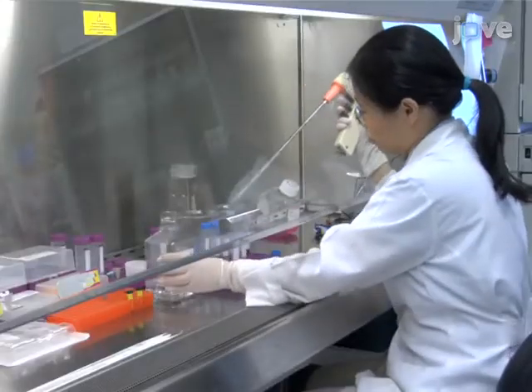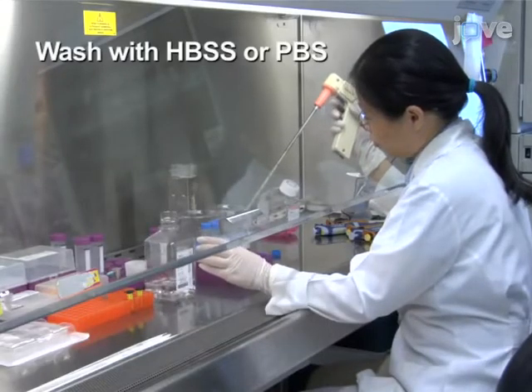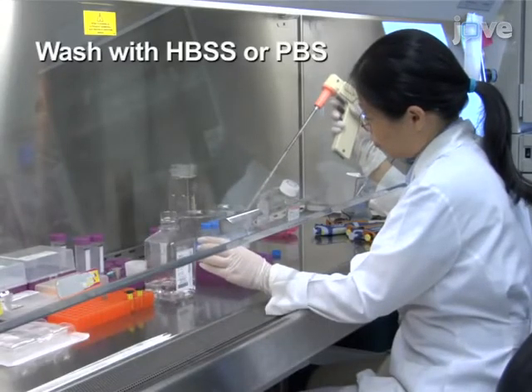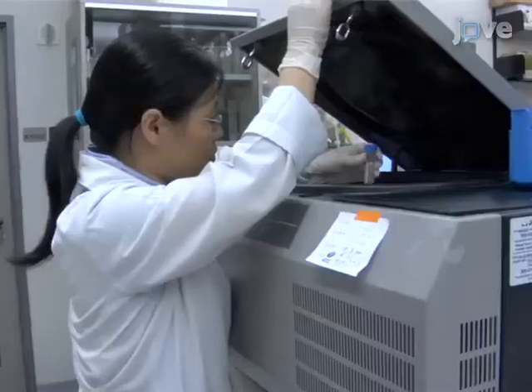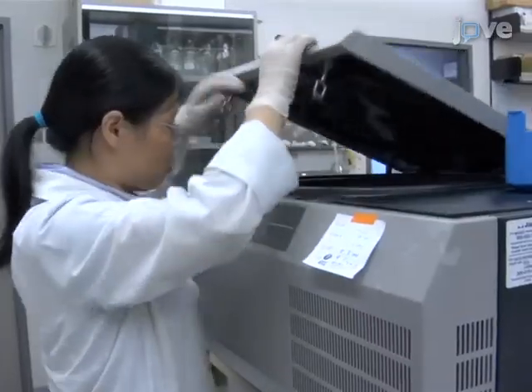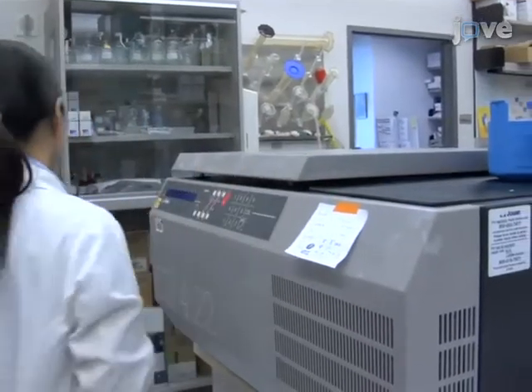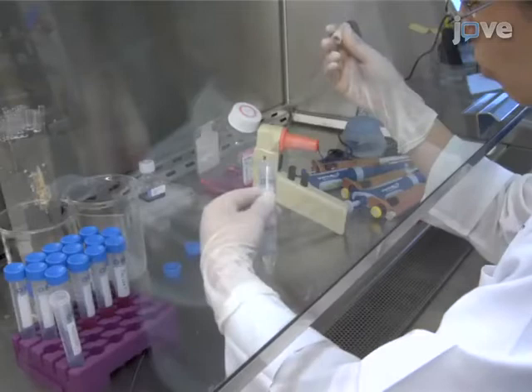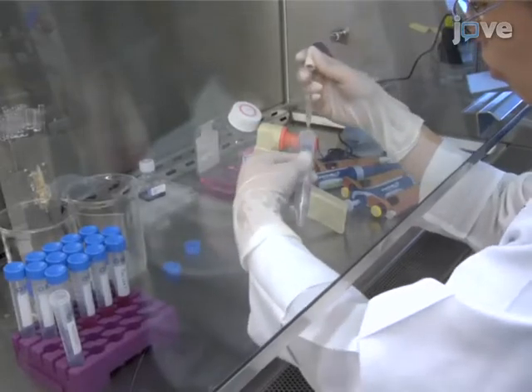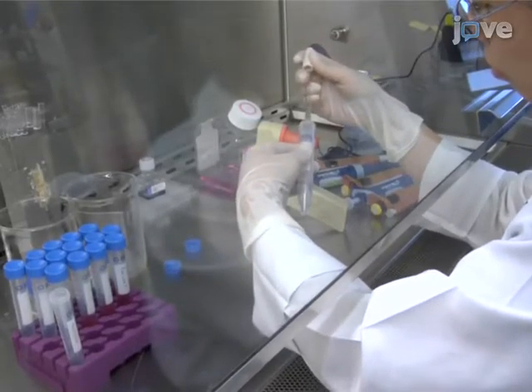Wash the cells with Hepes buffered salt solution or phosphate buffered saline to remove traces of the original medium. In this assay, we use the Human Leukaemia Jurkat cell line. After centrifuging, dispose of the supernatant.